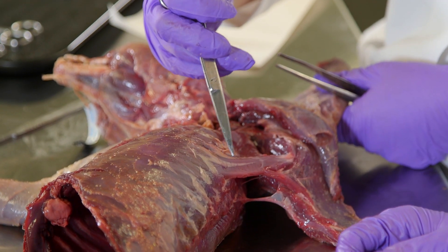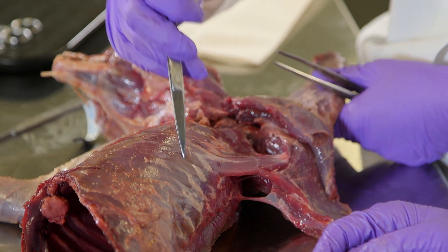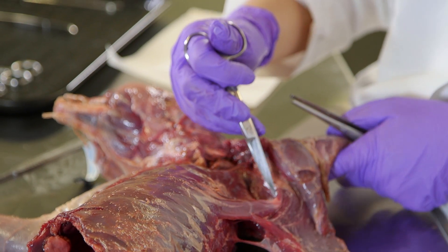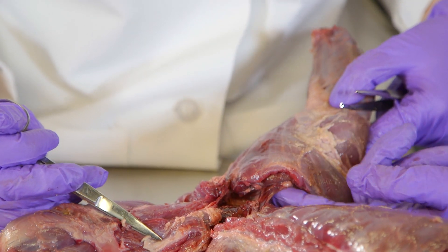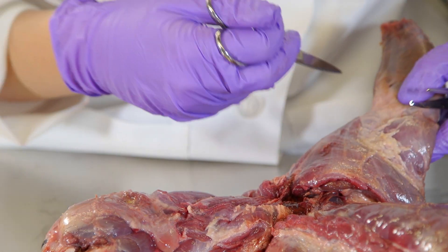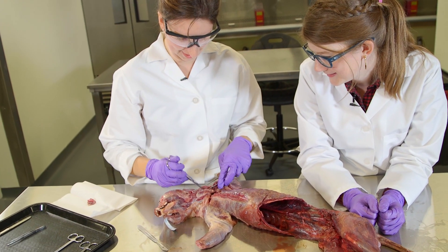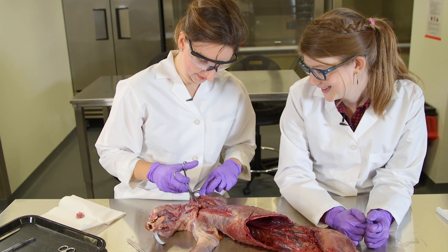This muscle, the serratus ventralis, actually has muscle fibers that insert in each rib, so it kind of looks jagged — that's where the name comes from. It goes all the way from the back to individual ribs. And this is called the brachial plexus — a really dense web of nerves. This is how you get nerve impulses in to move the muscles and sensation out. I'm actually going to cut through the brachial plexus, and he can't use his arm.